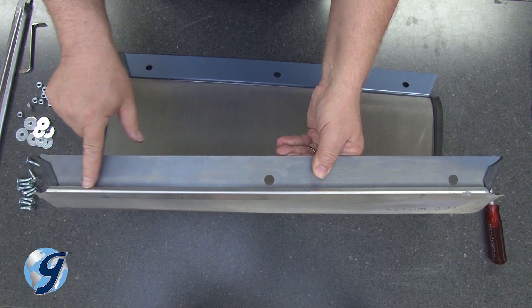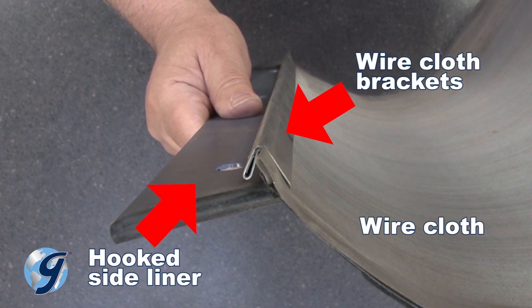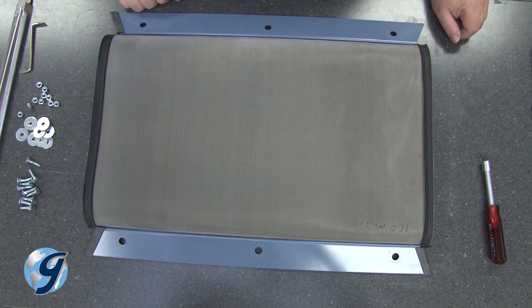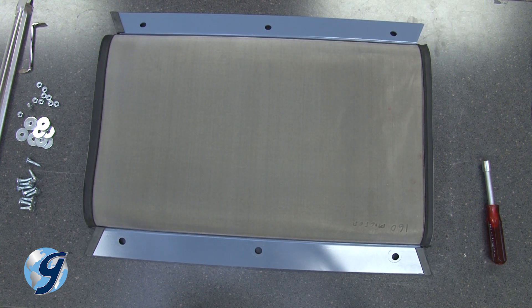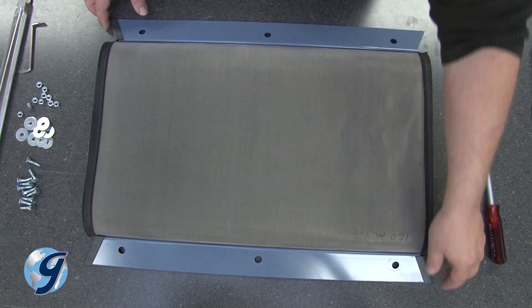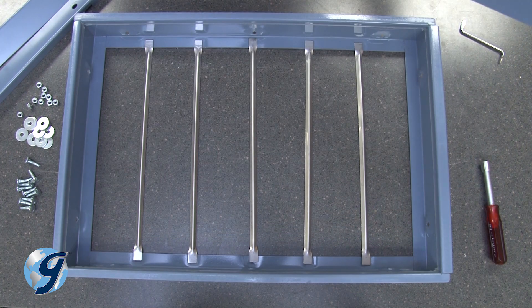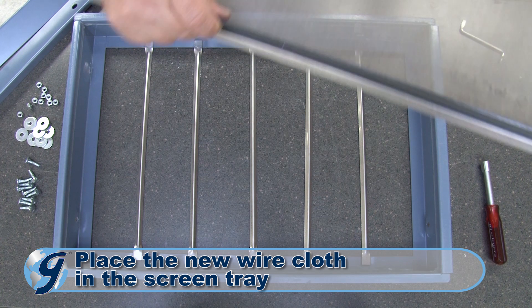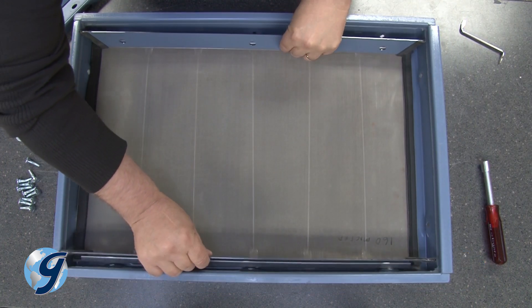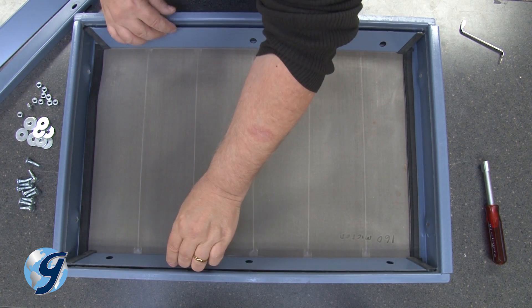New fine mesh wire cloth comes with metal side brackets, which attach to hooked side liners specifically designed to firmly hold the fine mesh wire cloth. For this demonstration, we are not actually replacing the wire cloth, and consequently we are not removing the wire cloth from the hooked side liners. To continue, carefully place the new fine mesh wire cloth with its metal side brackets attached to the side liners into the screen tray. Be sure the wire cloth is centered within the screen tray.